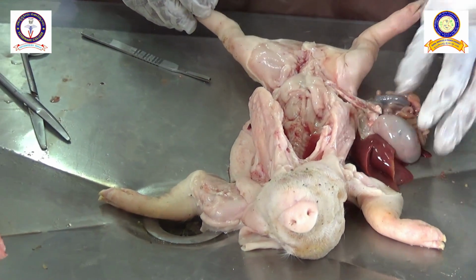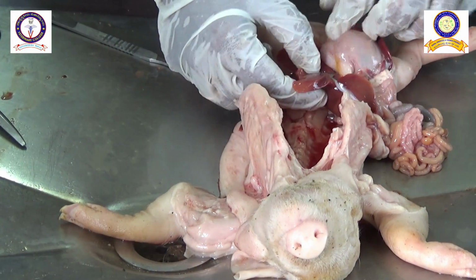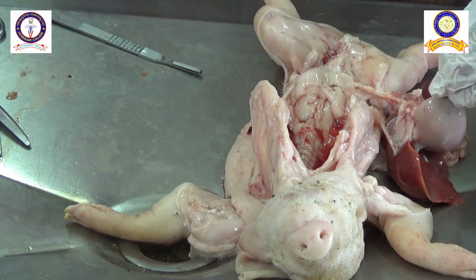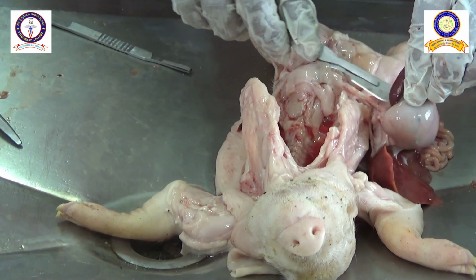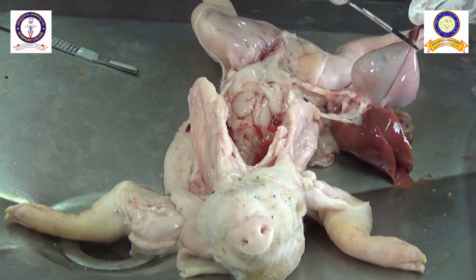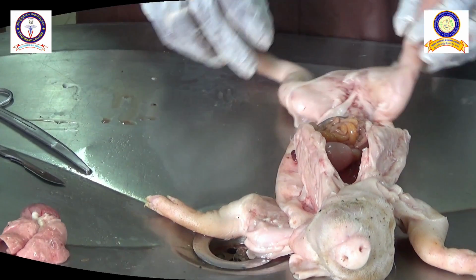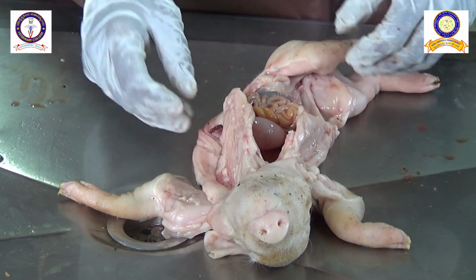This is an indication that there might be some type of agony experienced by the animal before death, and you can also see a few areas of hemorrhages here and there. The skin is also showing certain hemorrhagic areas. All this is related to maybe even septicemic changes. So let's go into a detailed investigation by removing the organs.